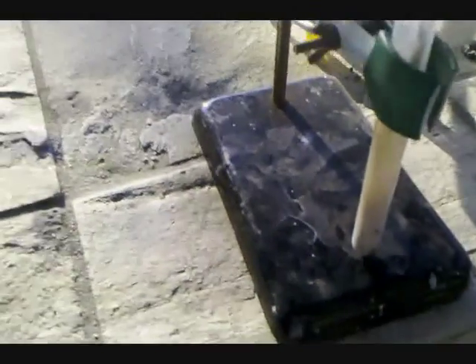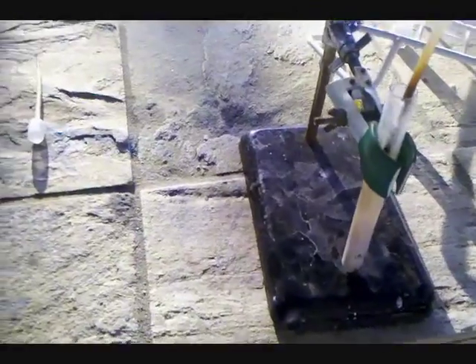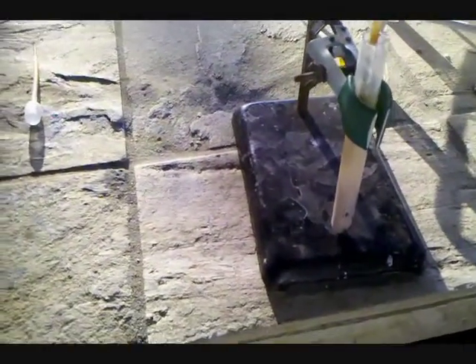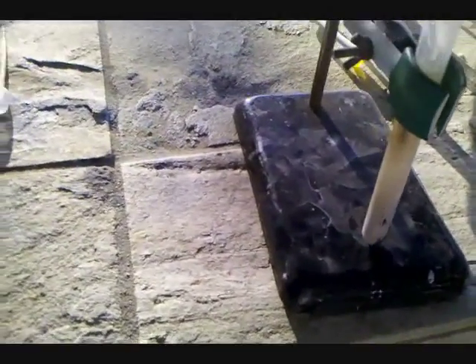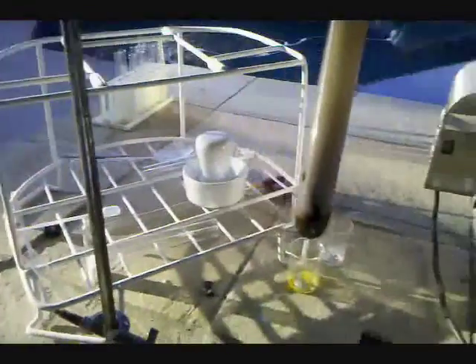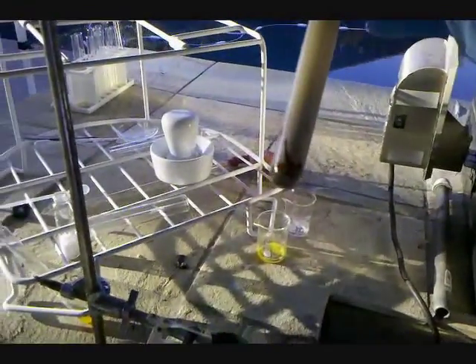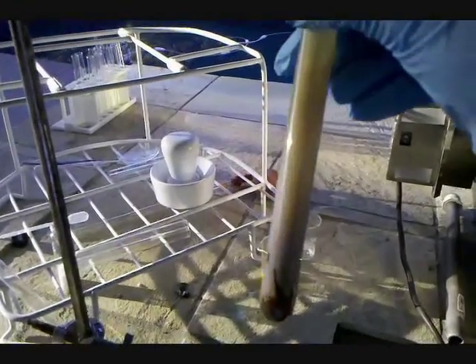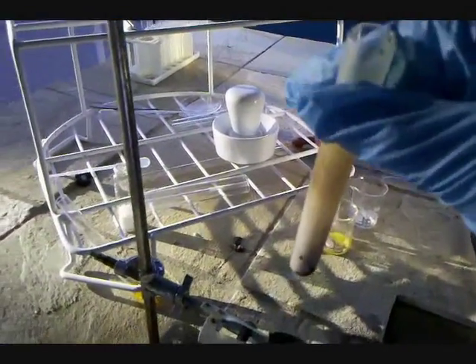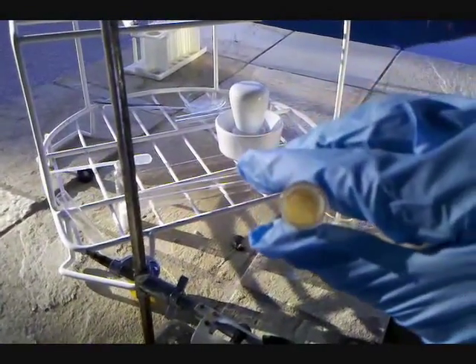A violent reaction occurs. You can see at the bottom of the test tube where it splattered and filled the entire thing with smoke. Quite a violent reaction.